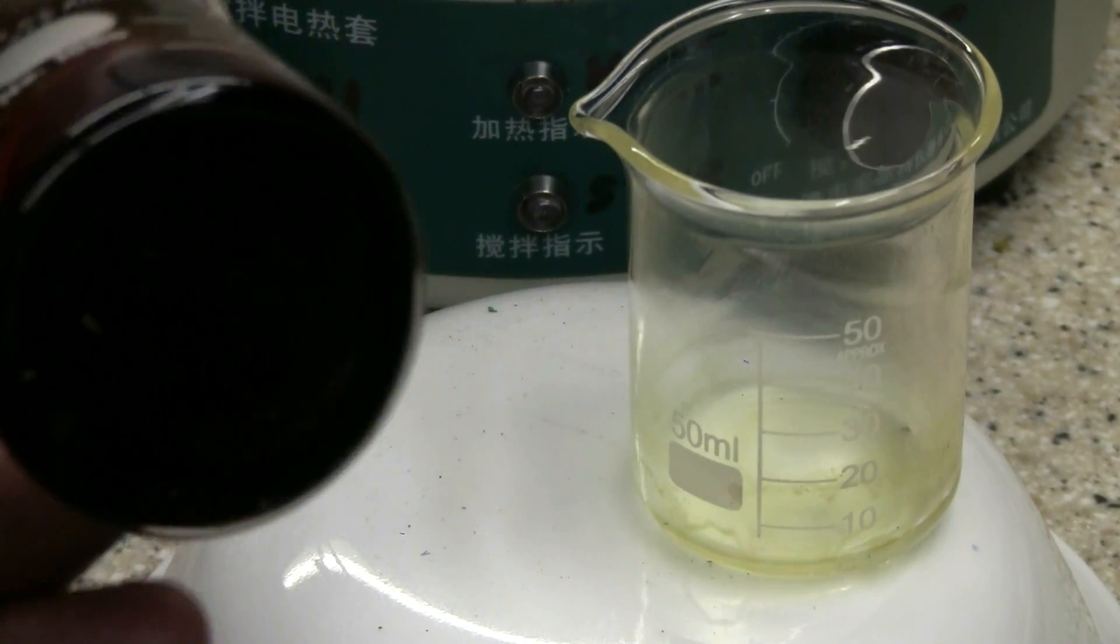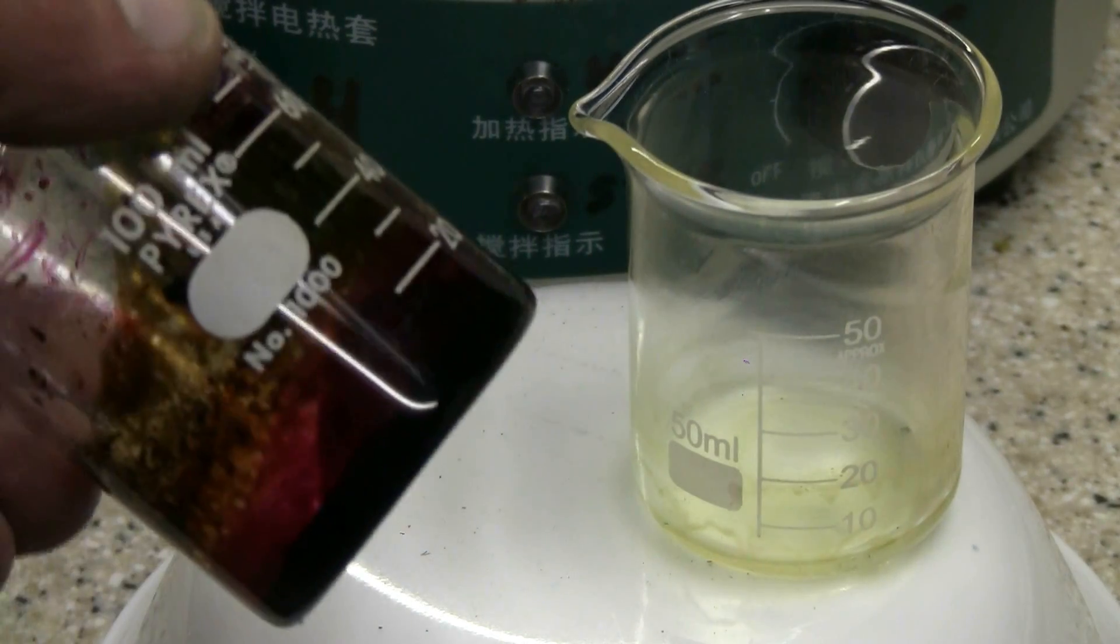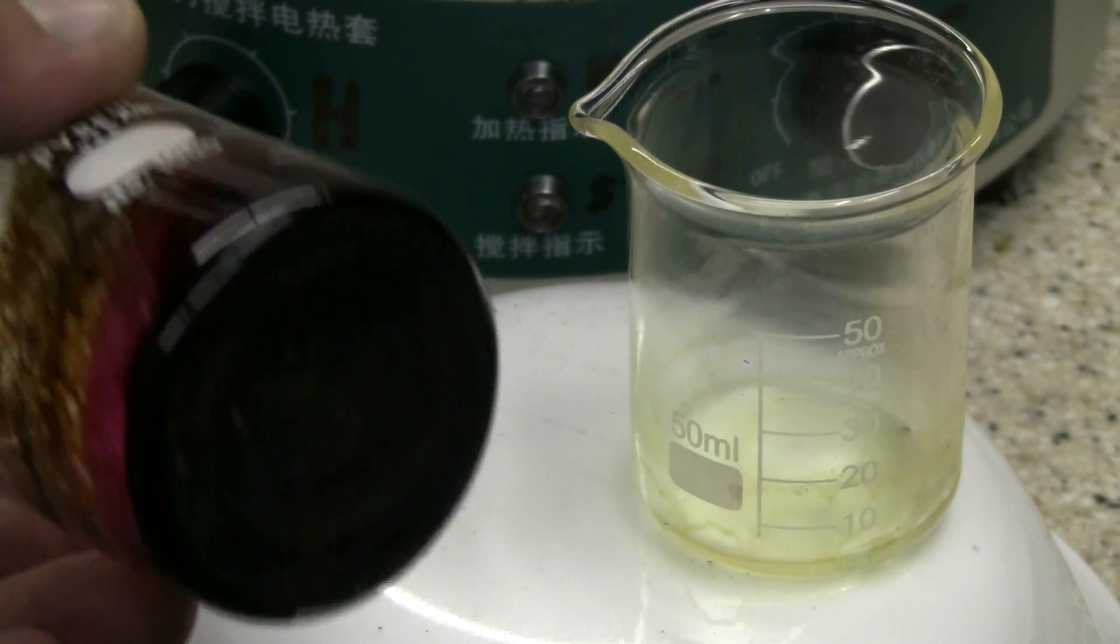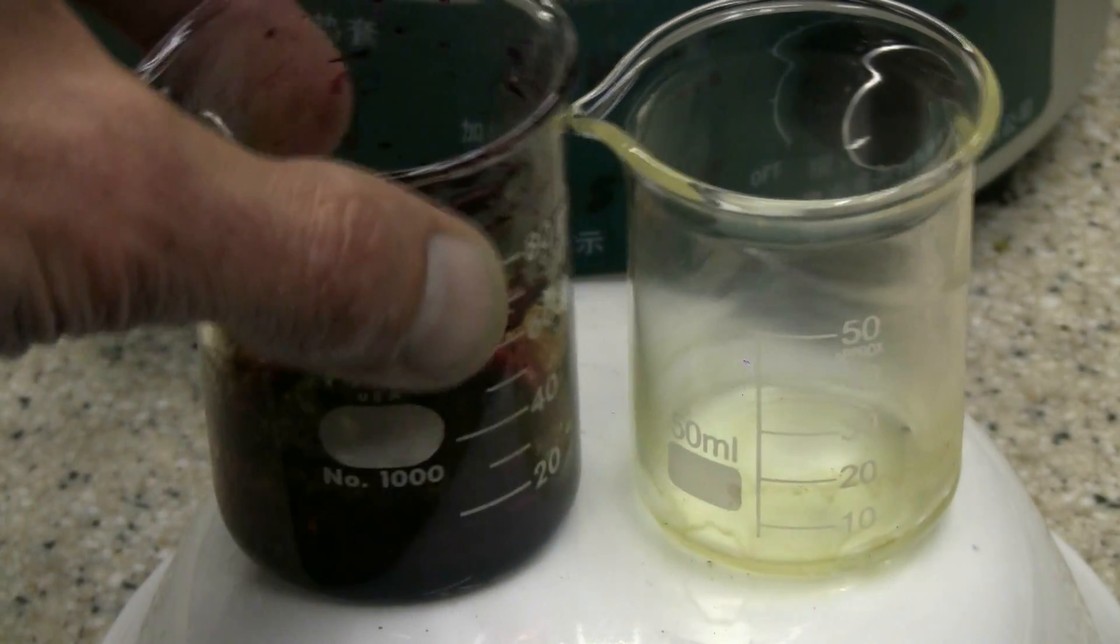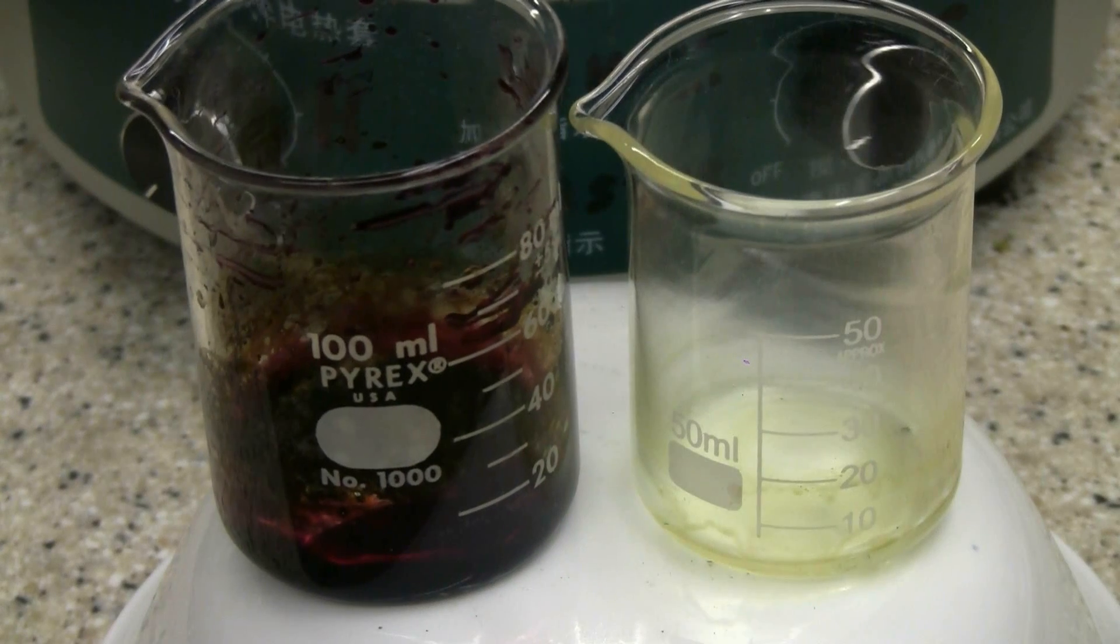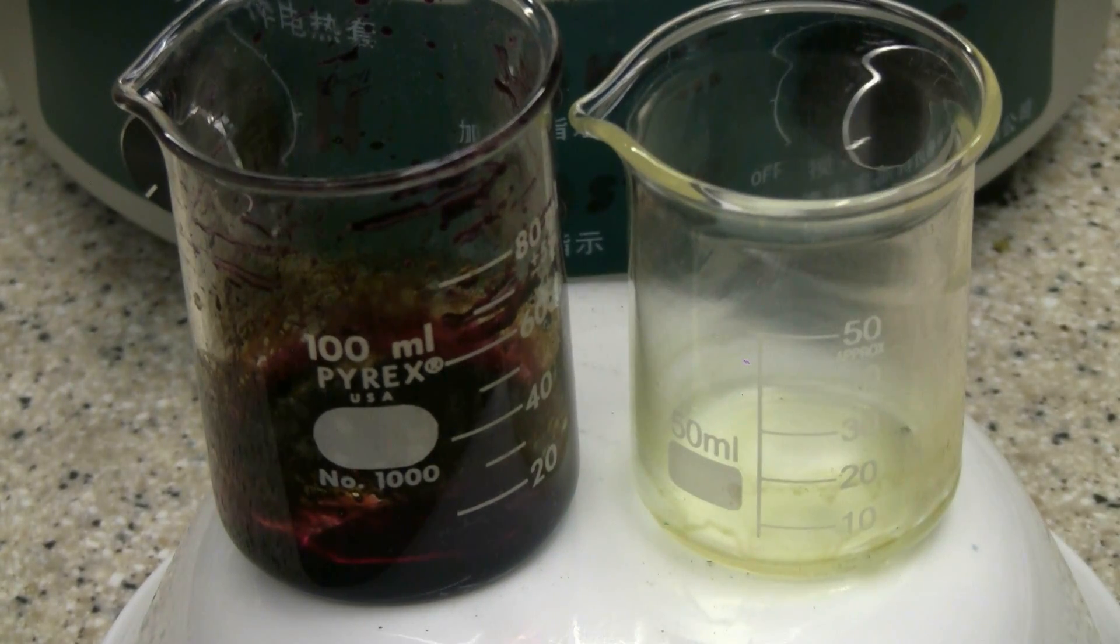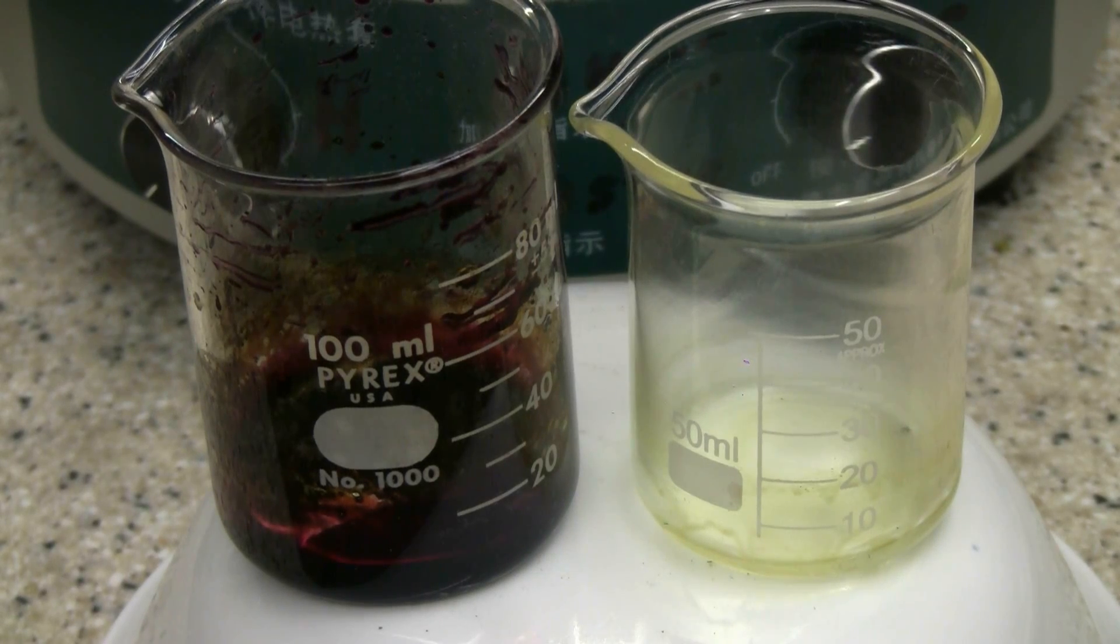The extraction performed with the ethanol has a nice reddish color to it, pinky red. They both smell slightly of peony flower petals too.